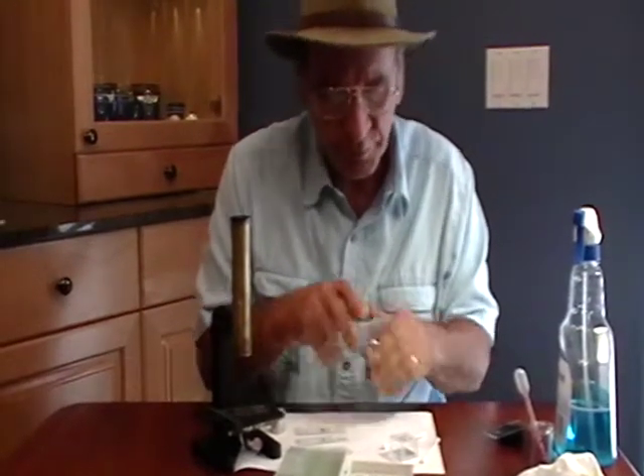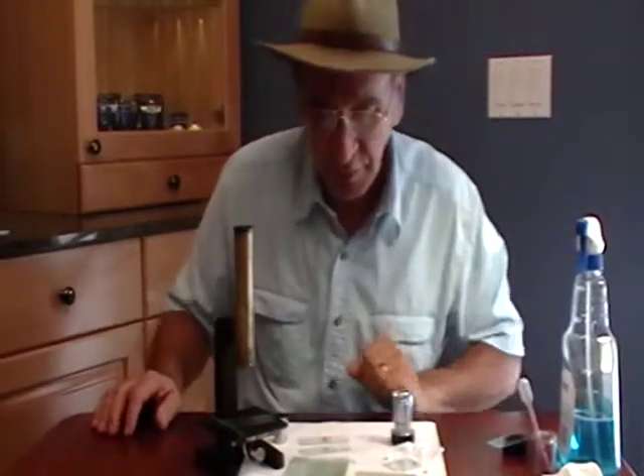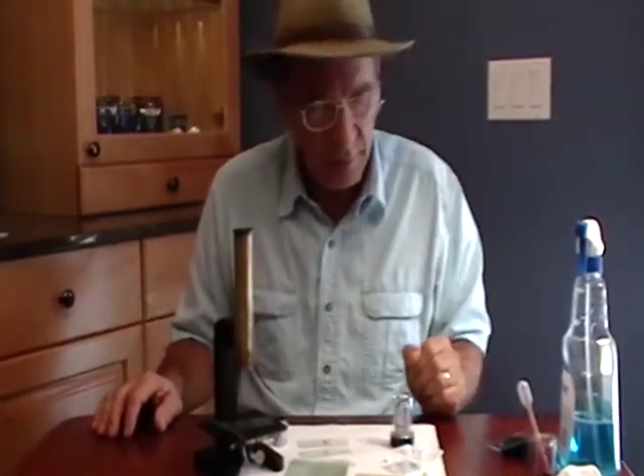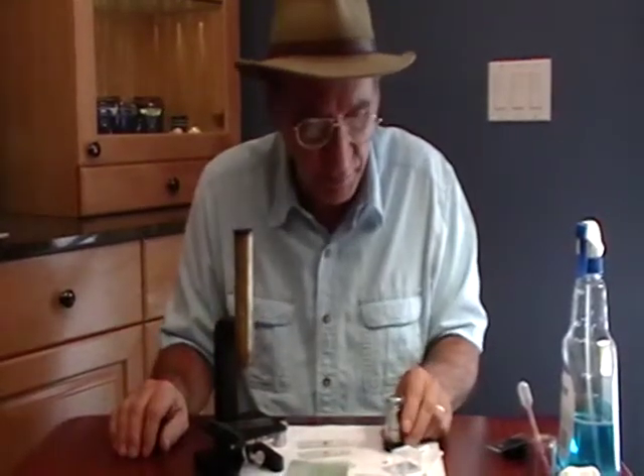Screw it together. Put it in a drawer — don't leave it on the microscope. It's going to get dirty, and it's really difficult to get it perfectly clean. It takes a high degree of skill, which is why I don't really recommend using these things unless you really need some high-detail work.